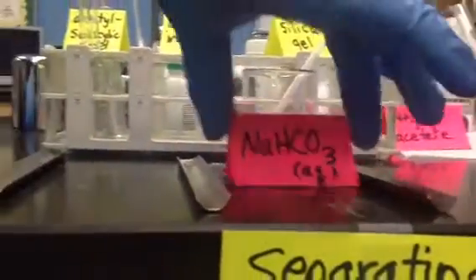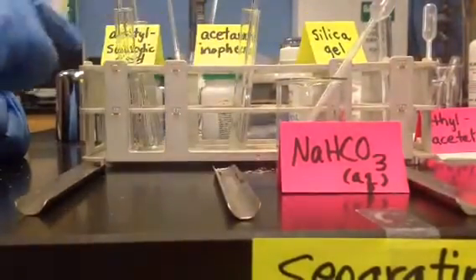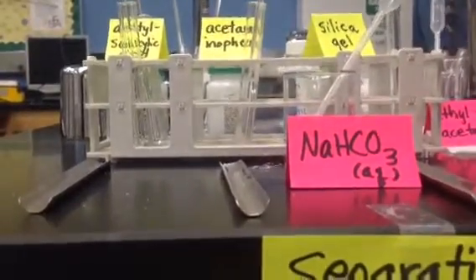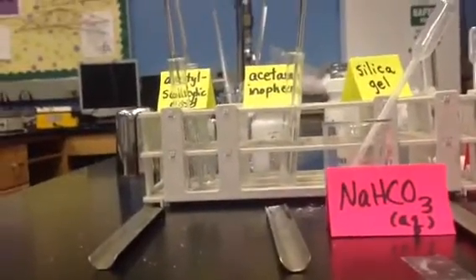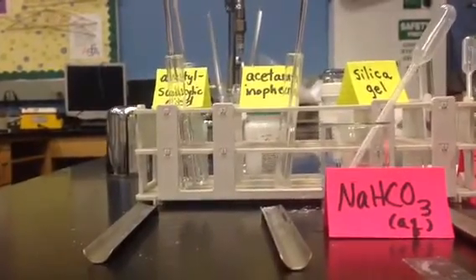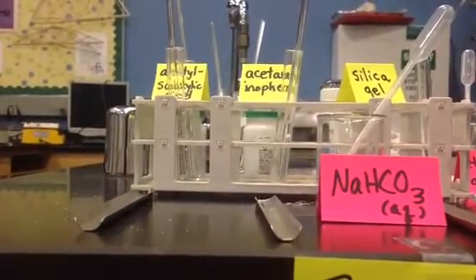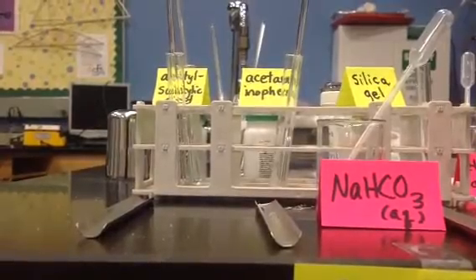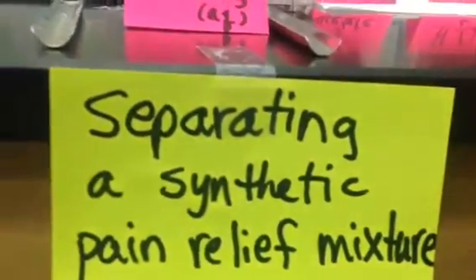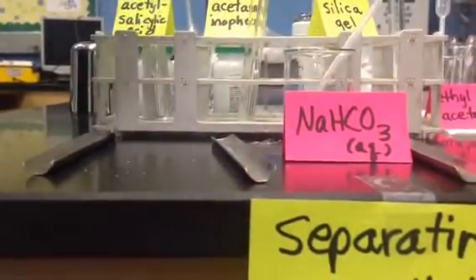So I'll move this over so you can see what we're doing for our solvent. Acetaminophen did not dissolve in this. Acetylsalicylic acid did dissolve in it. Now the thing you want to try next is, I'm going to get a bigger test tube because I'm maxed out on that one. We're going to use a bigger test tube because I want you to see what's going to happen, if anything.